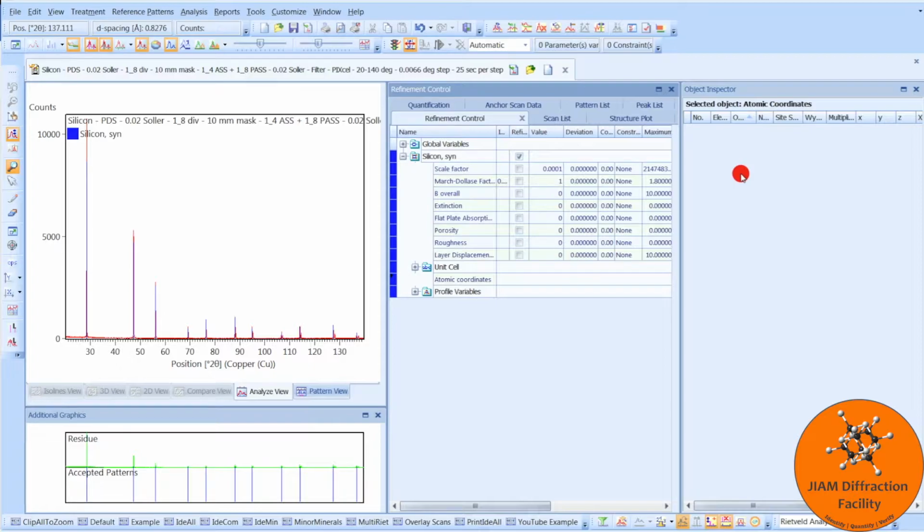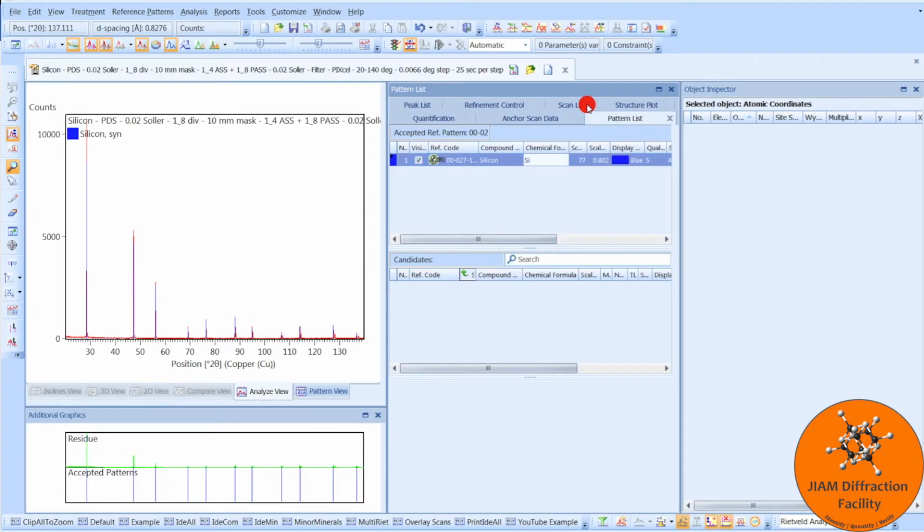Now, if you want to solve this problem, there are three different options. The simplest option is to go back to your pattern list, and if you have any other candidate patterns down here, you can choose one of those that does have atomic coordinate information in it.